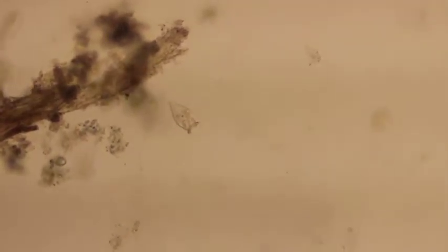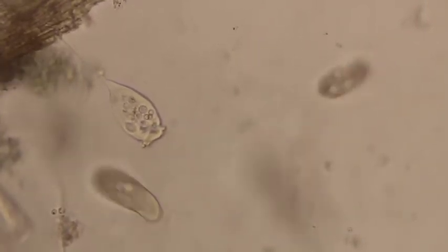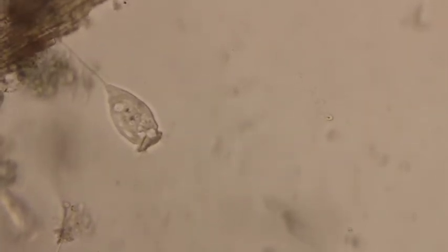So right in the middle here, this is our Vorticella. We can see that it has a stalk and it's just sitting there. And we can get really close to it here. There it is. Right around its mouth, you can see it has a mouth. Around its mouth, it has cilia. Those cilia basically create a current, and it uses that current to suck in all of the debris around the outside. It's a filter feeder. You can see a lot of various cells, small cells and things inside the Vorticella itself.